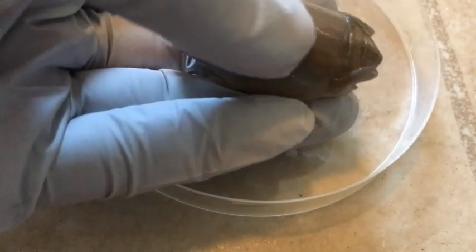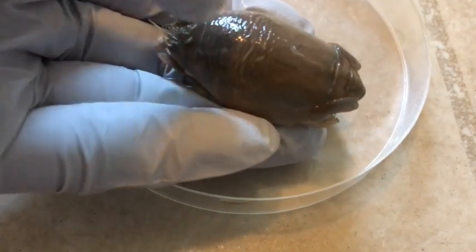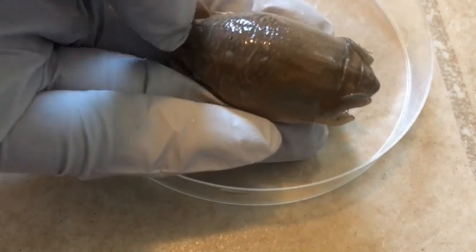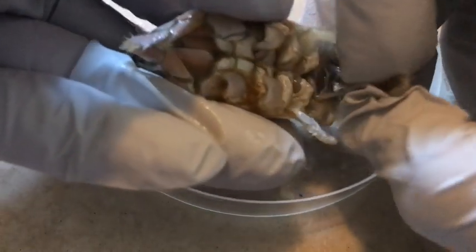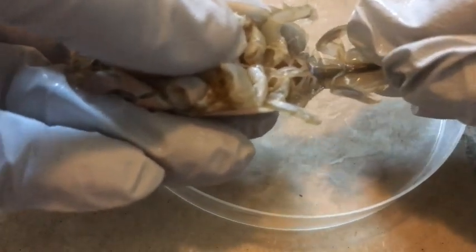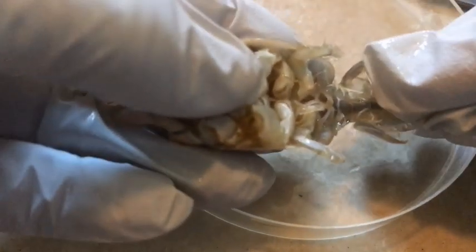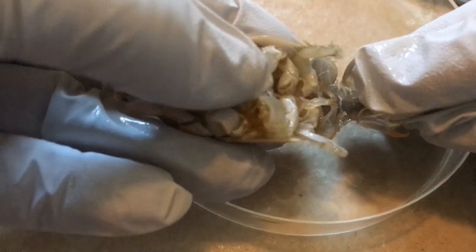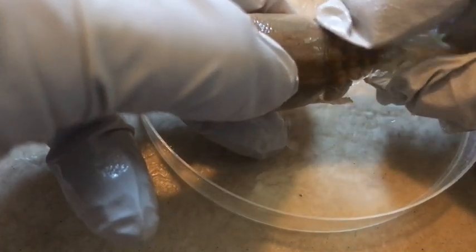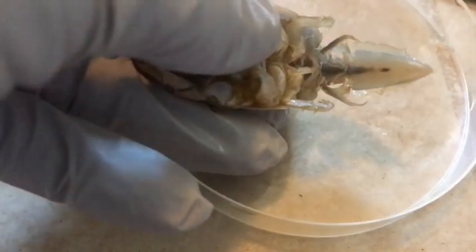As we talked about last week regarding sand crab anatomy, we're going to open up the carapace — the large top shell of the Pacific mole crab. But first we have to take off the telson. Remember the movable telson that sand crabs use to burrow into the sand? Once you lift it up, we can tell the gender of the Pacific mole crab. As we can see here, there are pleopods — the swimming legs — and only females have those pleopods, so this is in fact a female. You can also tell by her large size. We're going to cut right where the carapace ends and the telson begins to get the tail out of the way.